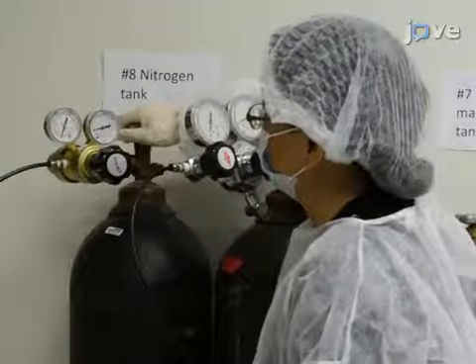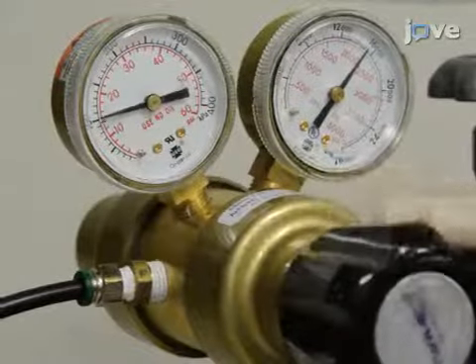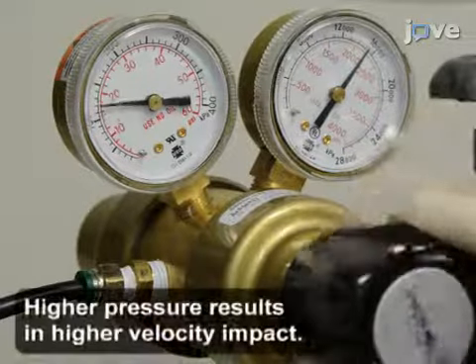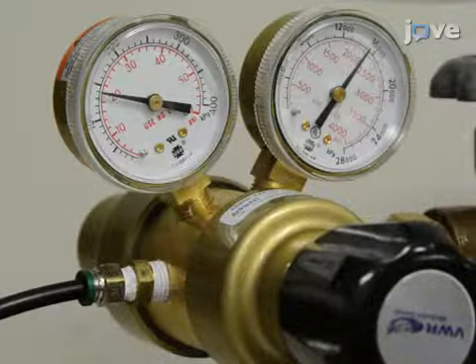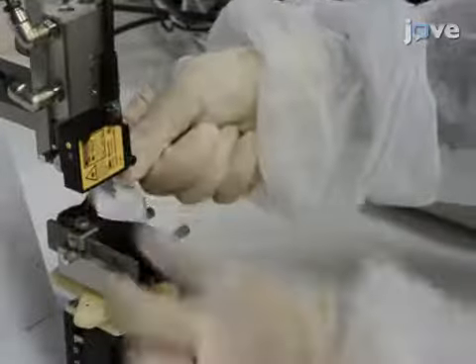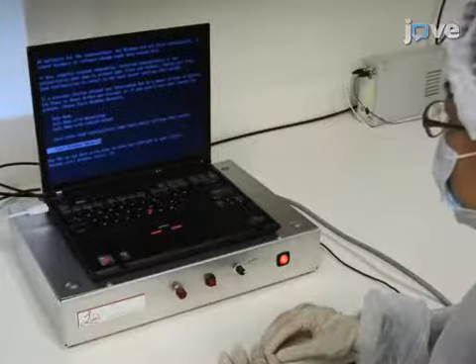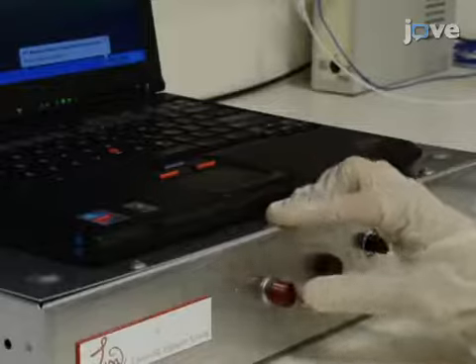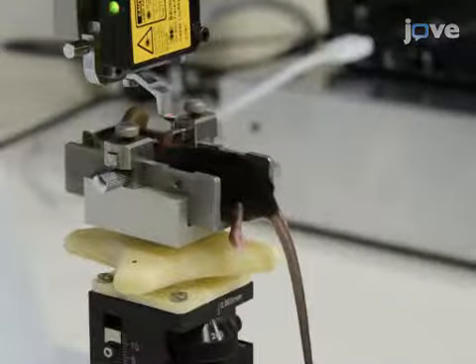To set up the impactor, first turn the knob of the pressure regulator on the nitrogen tank to set the compressed nitrogen to 20 pounds per square inch or 138 kilopascals for this study. Sterilize the 1.2 millimeter impact tip with 70% alcohol. Then open the software package on the computer. Push button 1 of the control box to activate the impactor tip into a fully extended position.